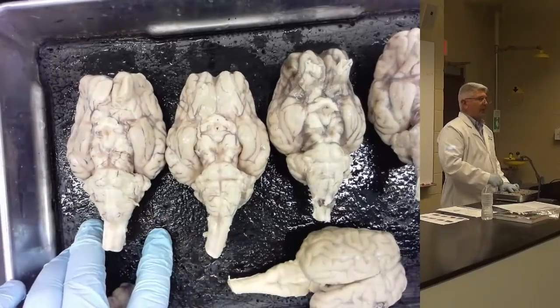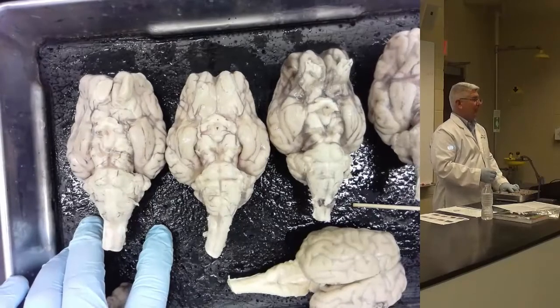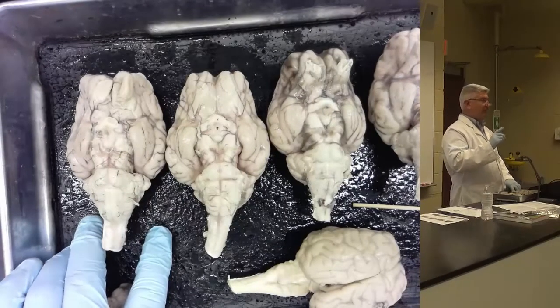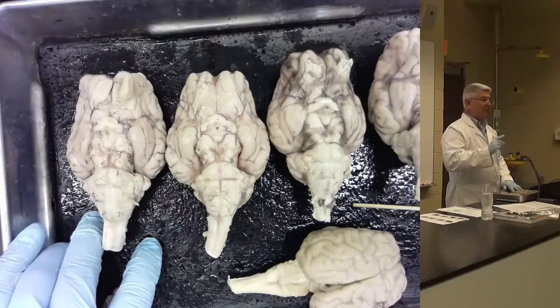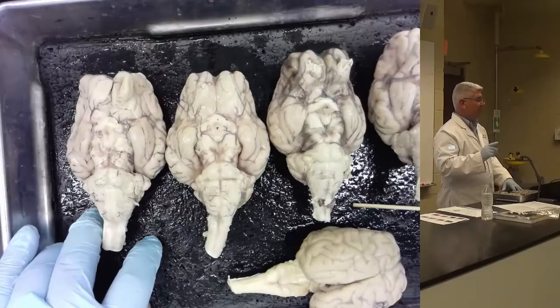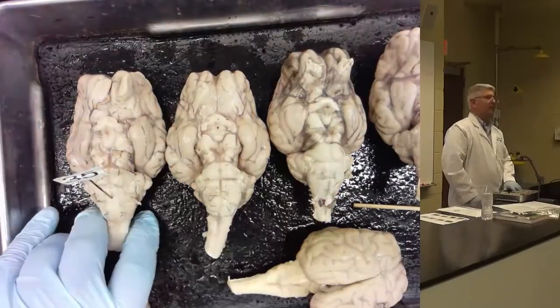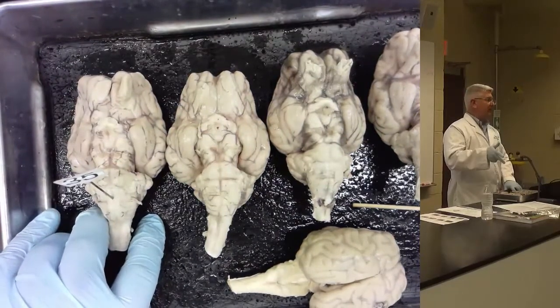And there's three things that can be marked on the medulla. One is easy because it's a fissure, and it'll say fissure or sulcus. And it's even easier because what side of the brain are we on? And where's the fissure located? On the midline. It's the ventral median fissure.